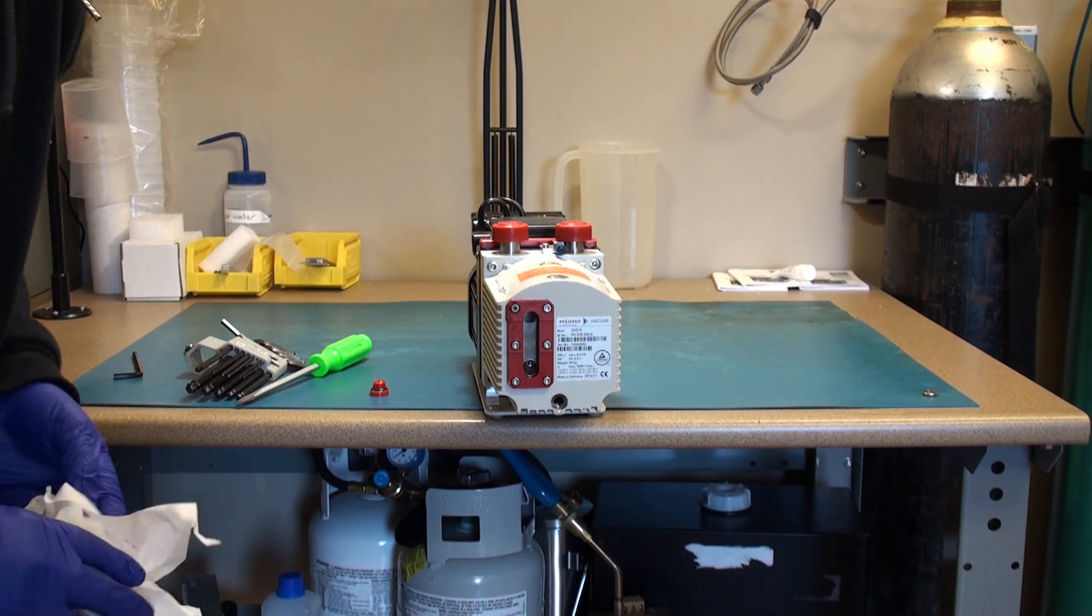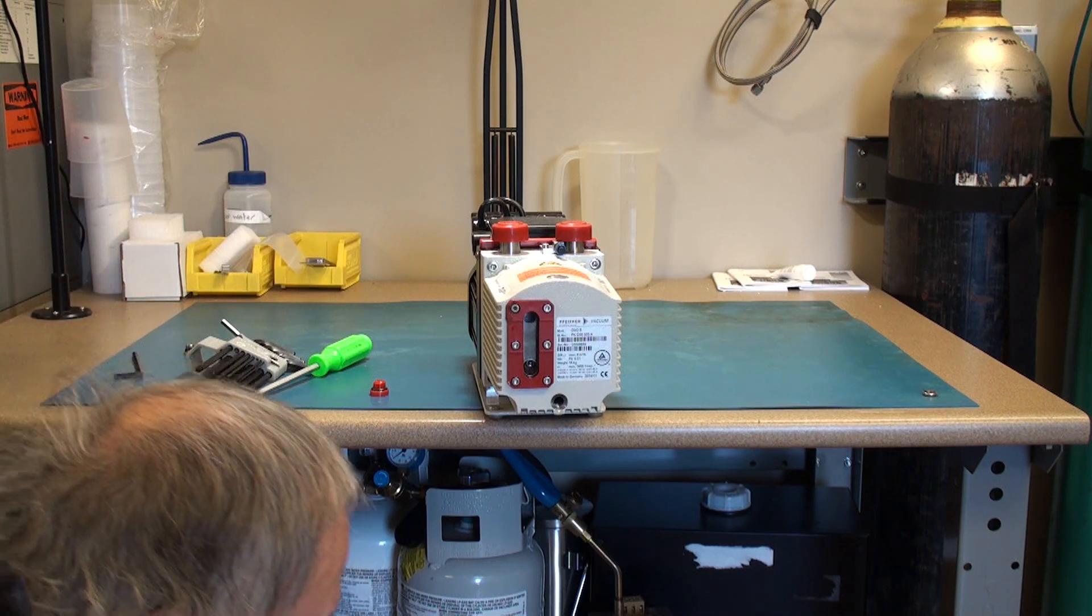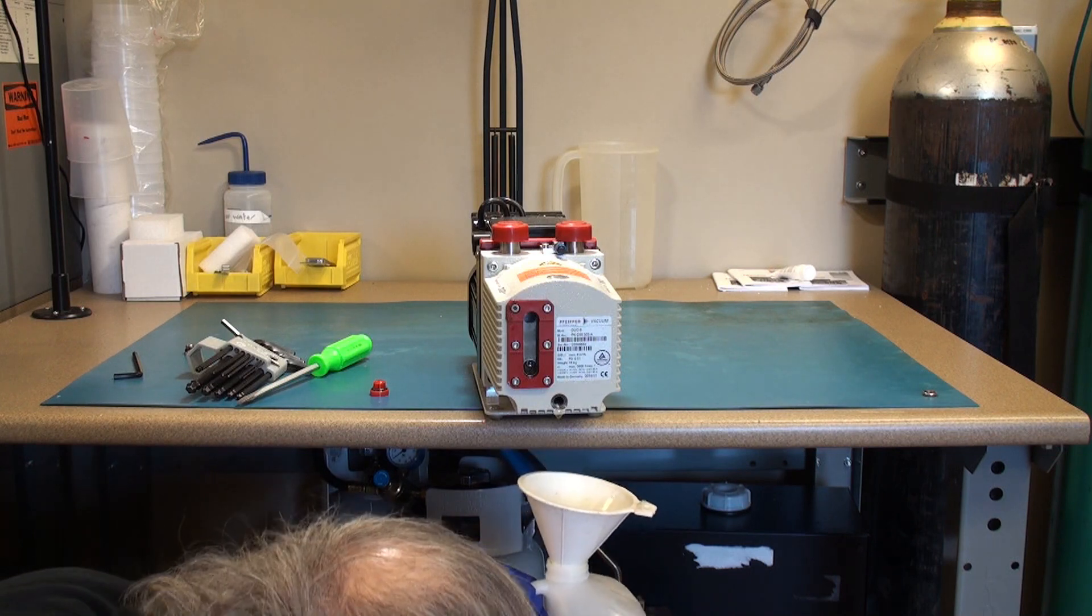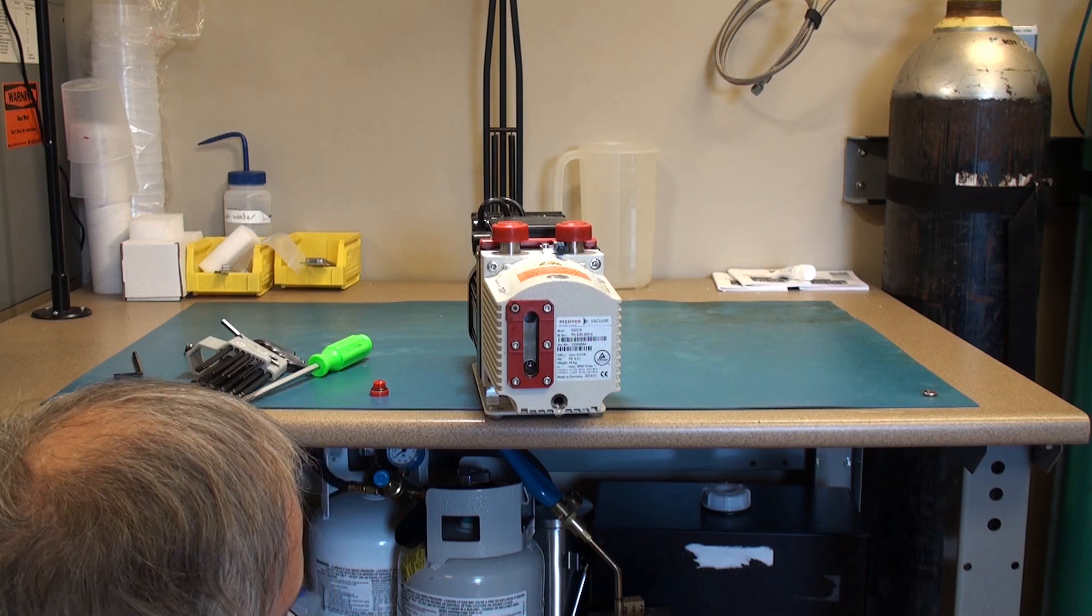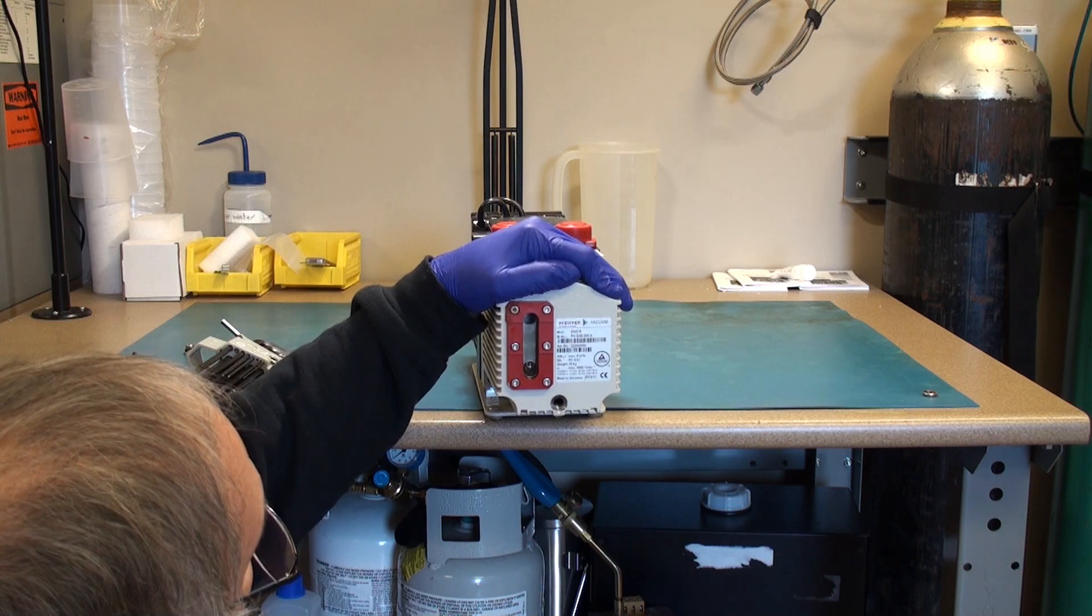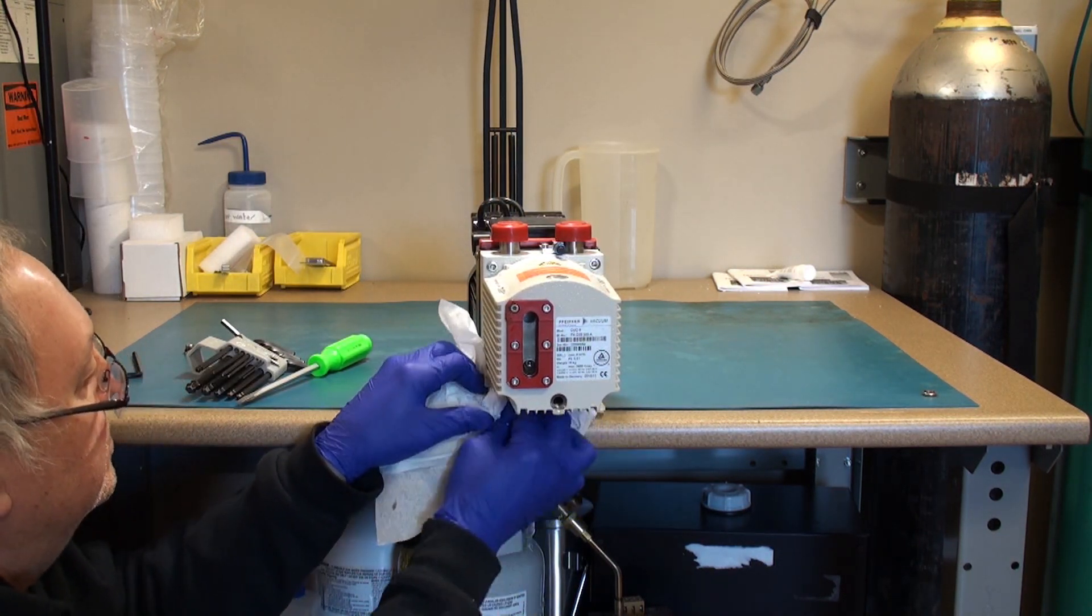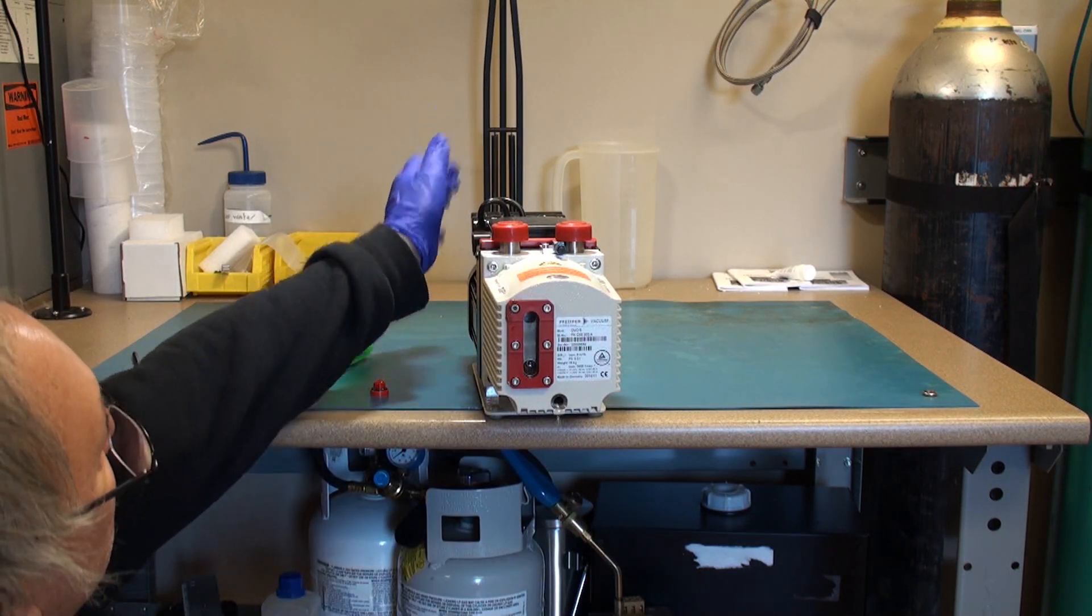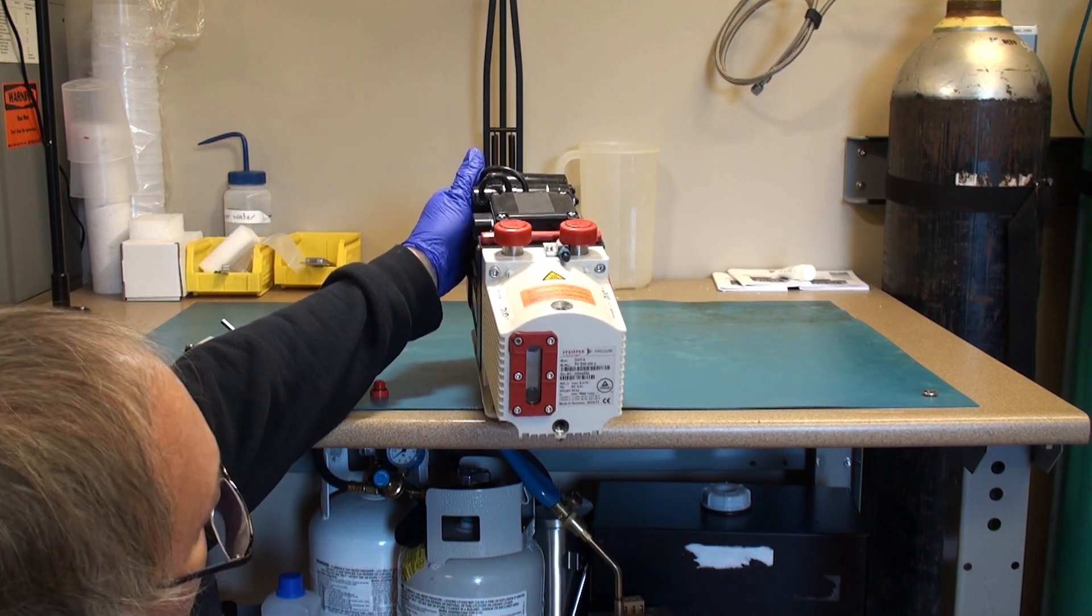I will always wear a pair of gloves and allow the rotary pump to drain completely.